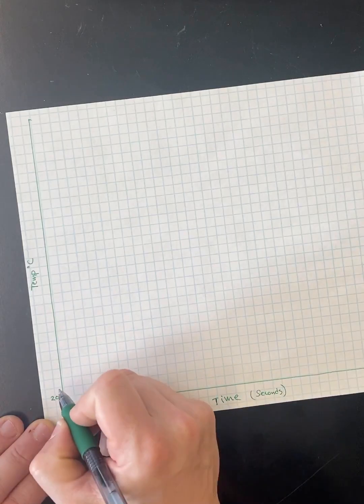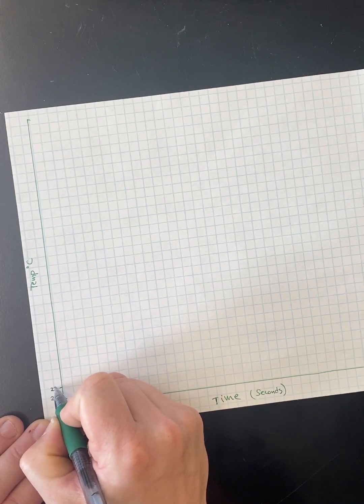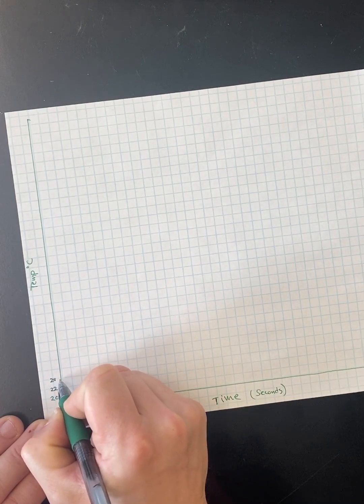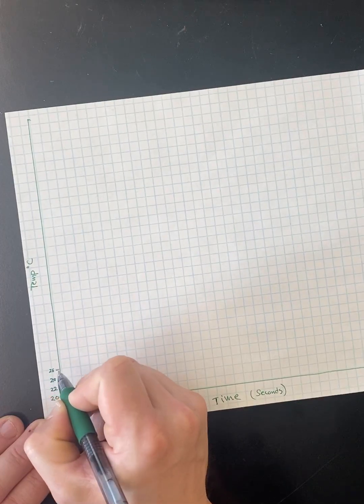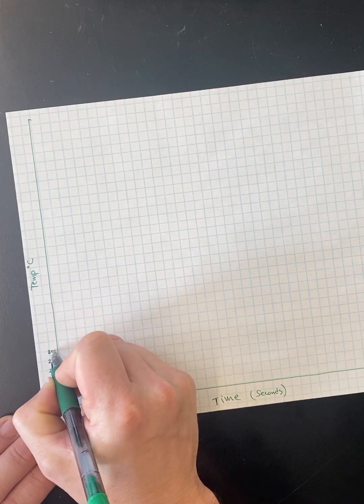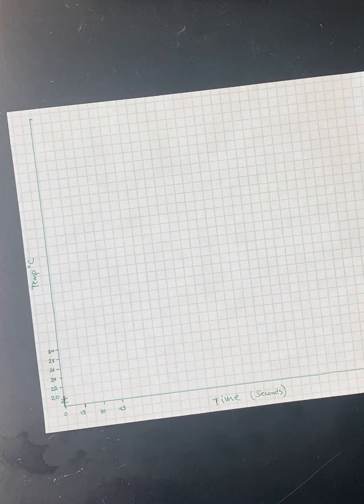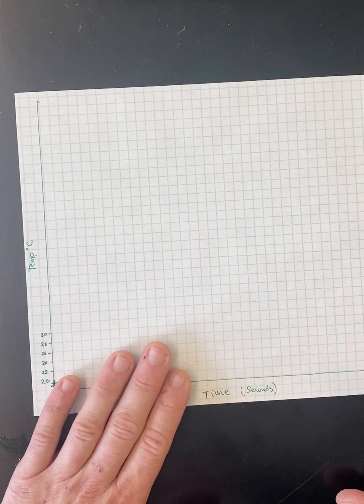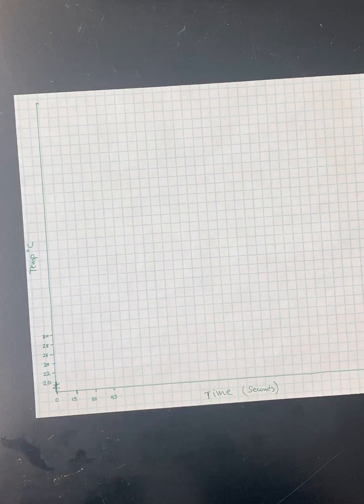Two per box should work. So 22, 24. Also, you should be doing this in pencil. I really shouldn't be doing this in ink. But if I make a mistake, I can just grab a new sheet of graph paper, erase this video and start it over.